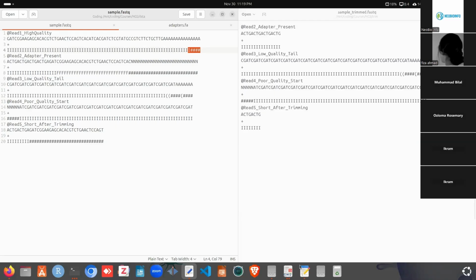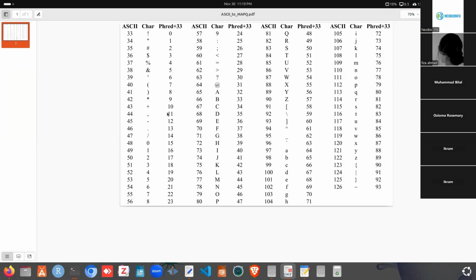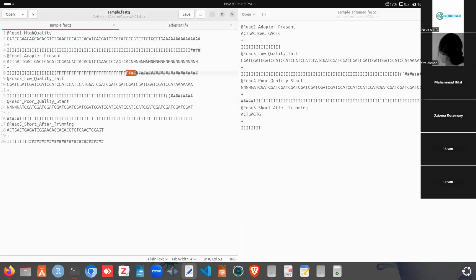And we can see what the quality of F actually is. For F, it is actually 37, so we can expect that it will remove from this position to the end, and for this base it will remove from here to the end. Okay, we can check by running the tool now, and for this we won't see from here.